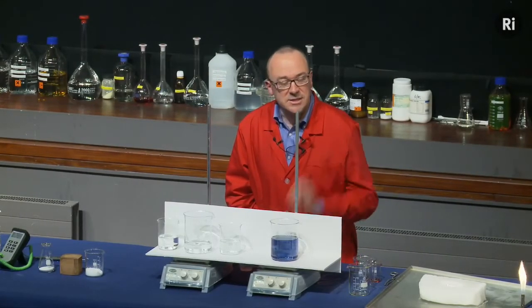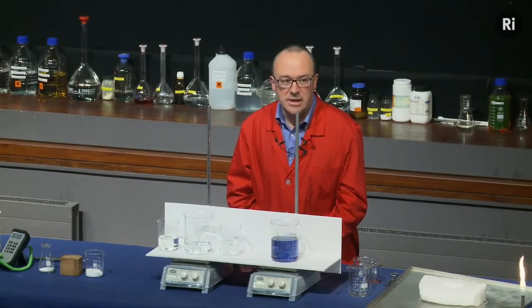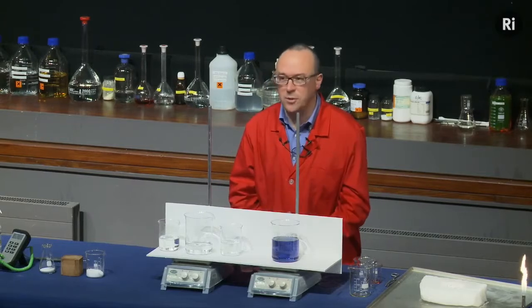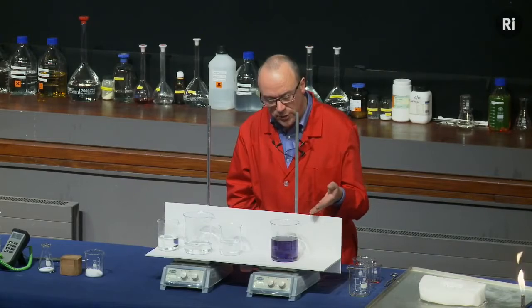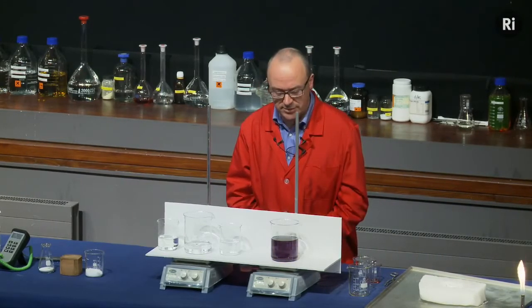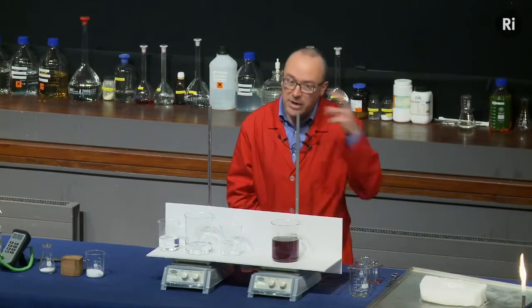So Zhabotinsky discovered Belousov's notes, and he recreated this experiment, and he was able to get this published at a conference in Vienna, and then the whole world knew about it, and it became quite a sensation. And people got very excited about these kinds of reactions. So you can see it's gone back to blue, it's now turning back to red, and it will keep going through that sequence of colours. So it seems as if we have a reaction that sort of goes backwards, or at least it goes round in a cycle.